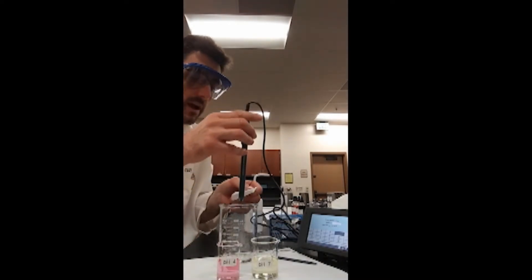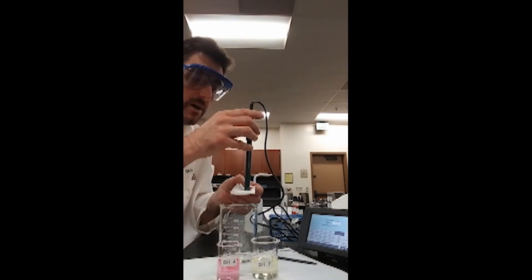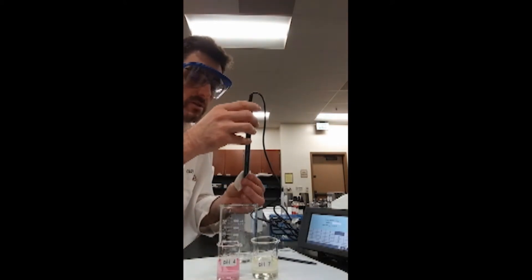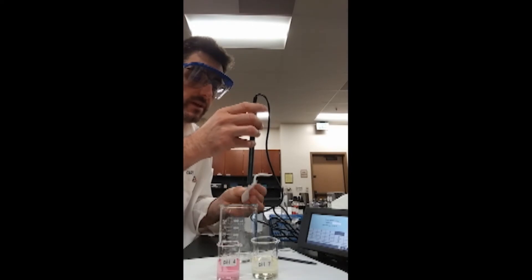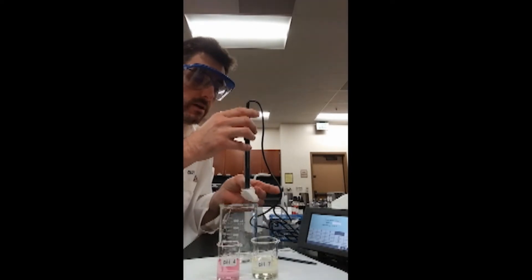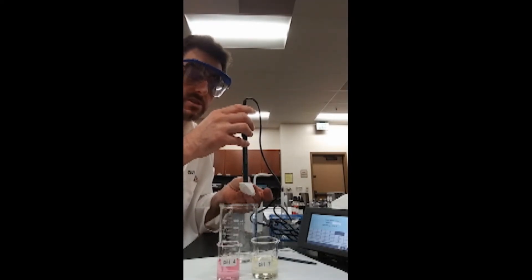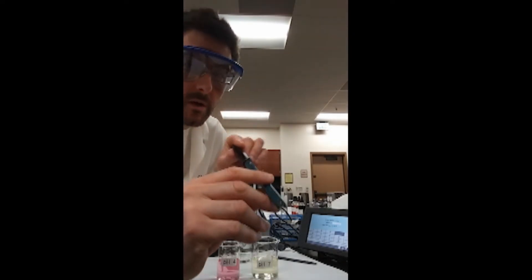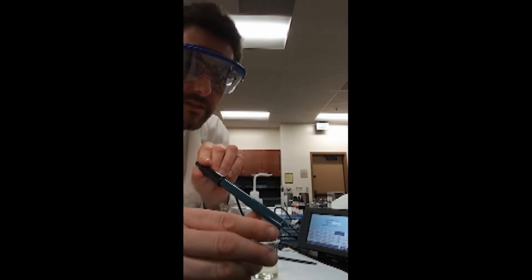Then, I'll carefully dab the probe so as to remove any excess water. This blotting process is performed while keeping mindful of the very delicate glass electrode at the tip.